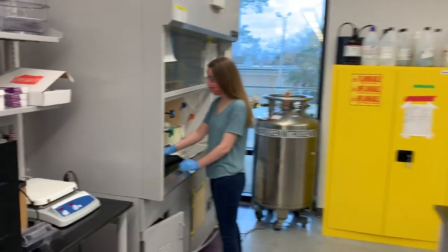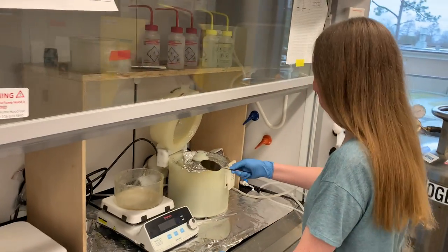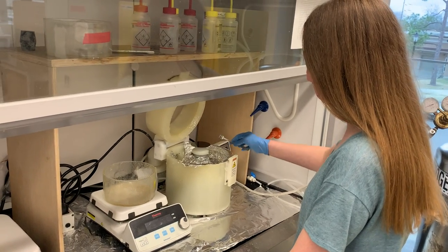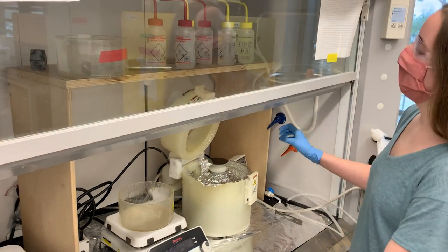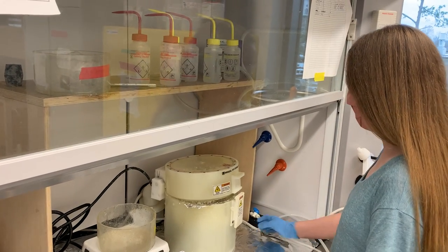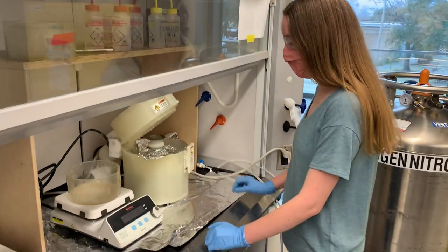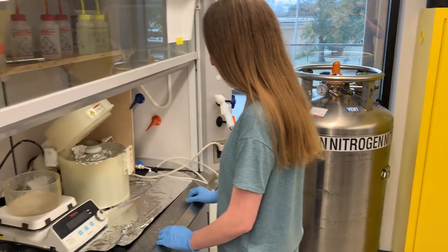We're first going to go over to our fume hood where we see Hannah, who is working on fabricating a silicon wafer that we use for making microfluidic devices. These are the first steps in the soft lithography process where she's going to turn on a vacuum pump and then deposit a thin layer of a photoreactive polymer, which we then put into our UV exposure box to start making the master molds used for making our suite of microfluidic devices. We'll show you some of these devices in just a second.